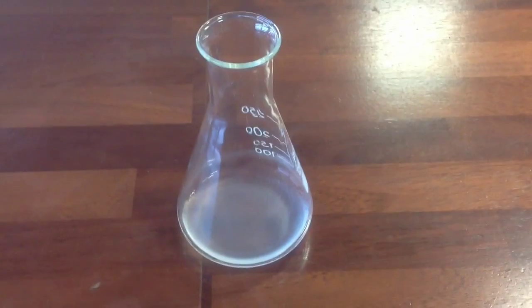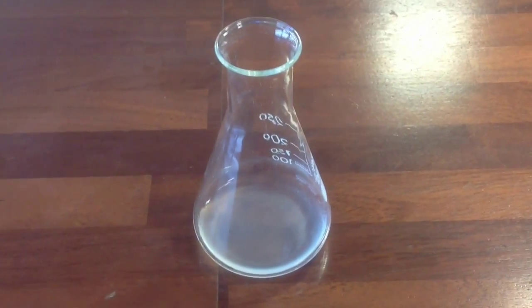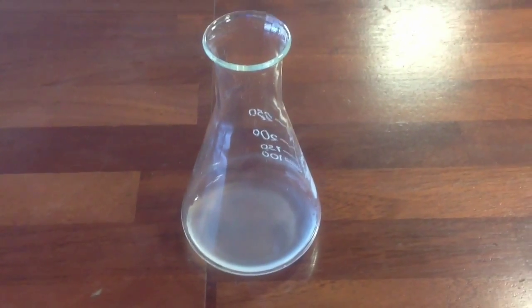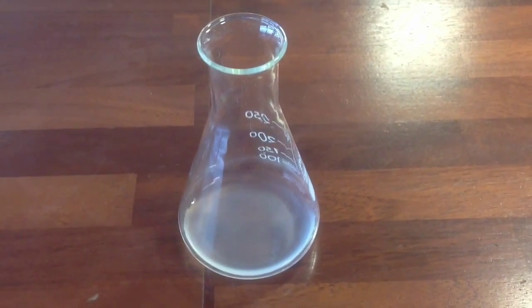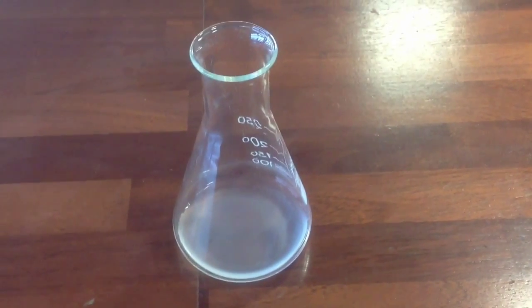You should be able to notice straight away signs that a reaction is taking place. The liquid will be going cloudy, and droplets of an immiscible substance will be appearing. The reaction takes a little while, so we'll need to leave the flask at this point for about a quarter of an hour to try and ensure as high a yield as possible.